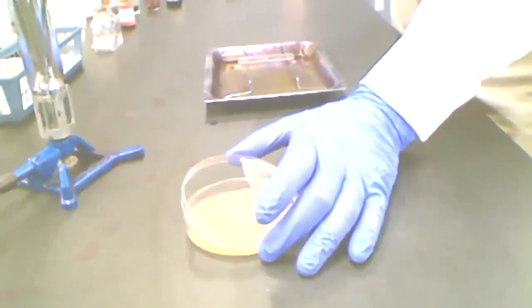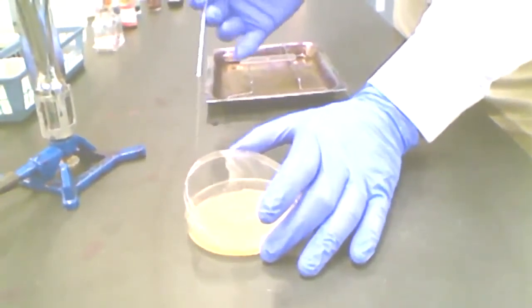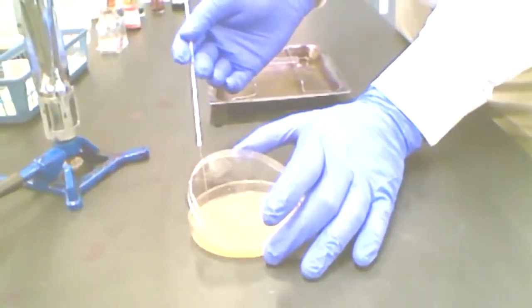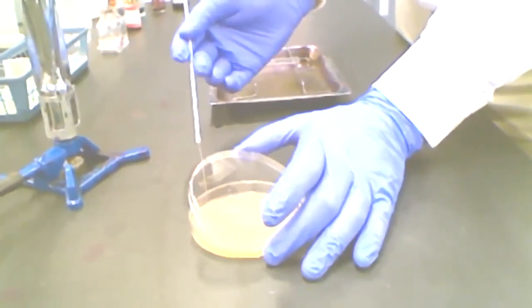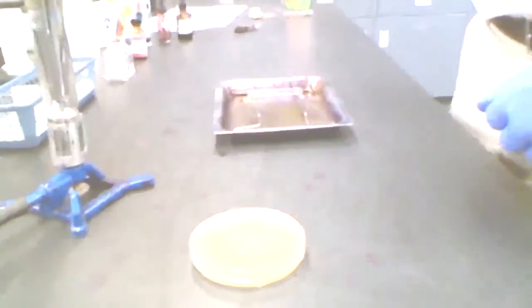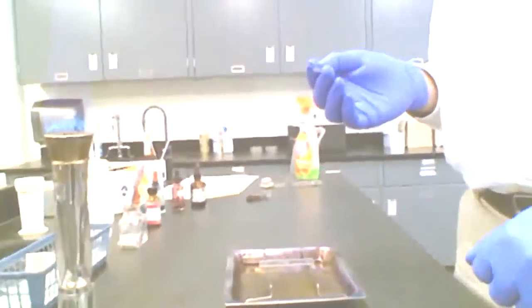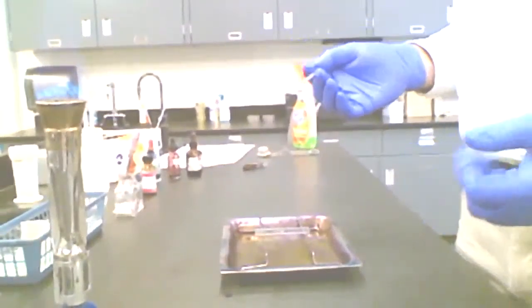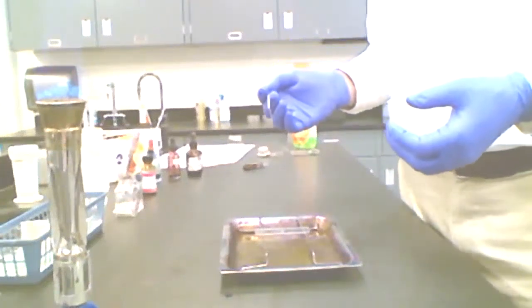Again, this is part of aseptic technique as well. I want to avoid allowing organisms from the air to fall on the surface. I generally tell my students when we're doing this, think about it like a clamshell. You're clamshelling the lid, so to speak. So I've got a very small amount of material on there. That's another thing that through trial and error you learn: less is more generally.